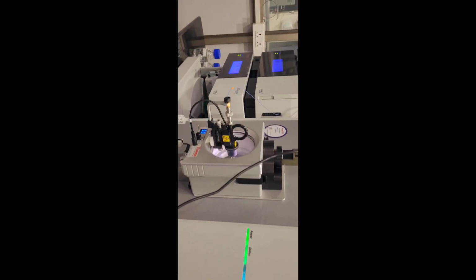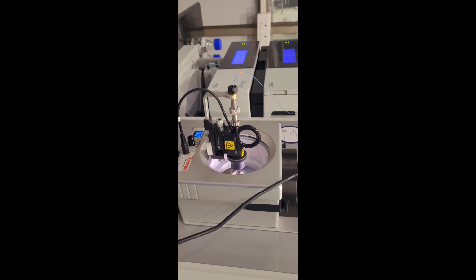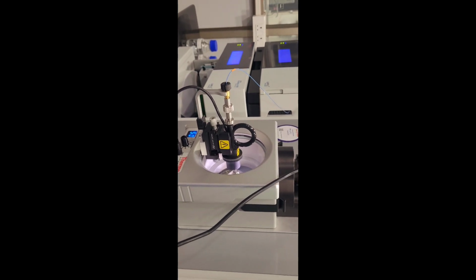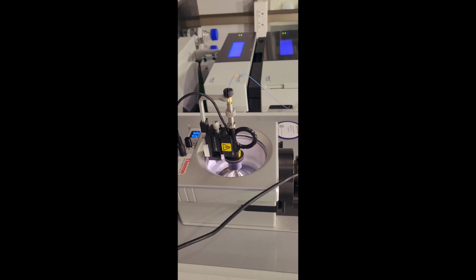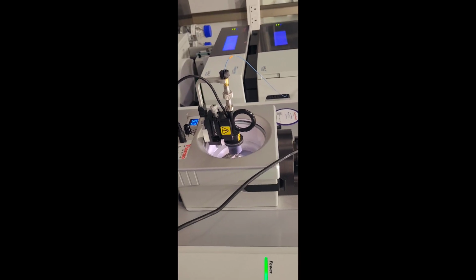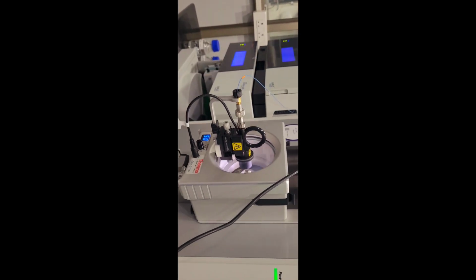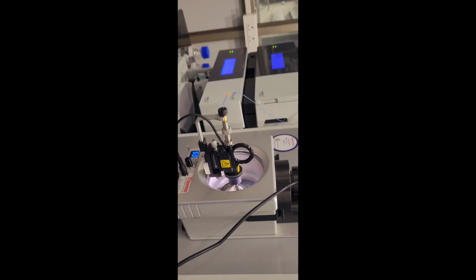Generally, the sample should be injected at less than 1 microgram, because the limit of this nano column is up to 1 microgram of sample. If more than 1 microgram is injected, it might damage the column. So in our lab we optimized around 650 nanogram of sample to be injected, 650 or 750 as per the user requirement.